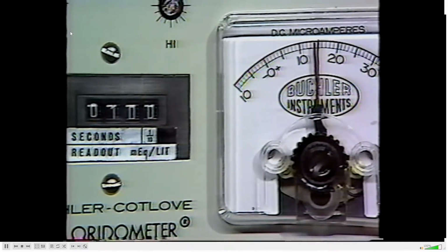If the standards read correctly, the machine is ready to titrate the control and unknown samples. Consult an instructor if you are unable to obtain consistent standard readings, or if readings are consistently outside of acceptable limits of deviation. To read controls and unknowns, follow the same procedure as standardizing the instrument. Remember, the digital readout records chloride concentrations in milliequivalents per liter when the direct reader switch is in the titrate position.